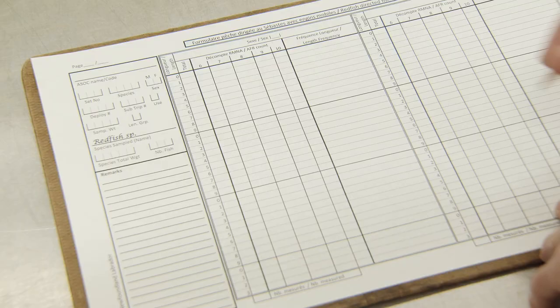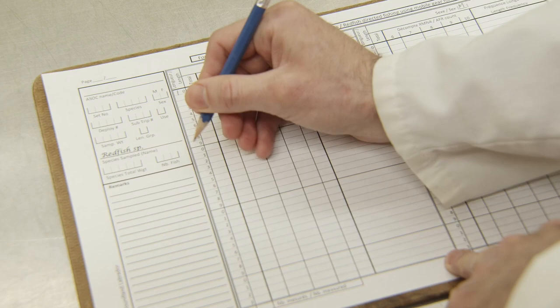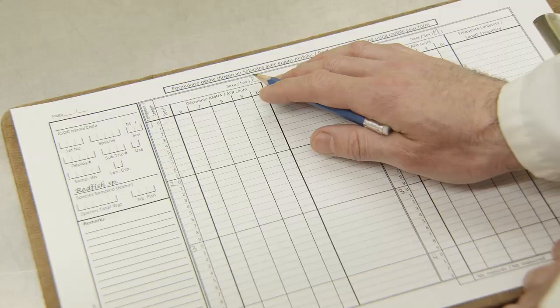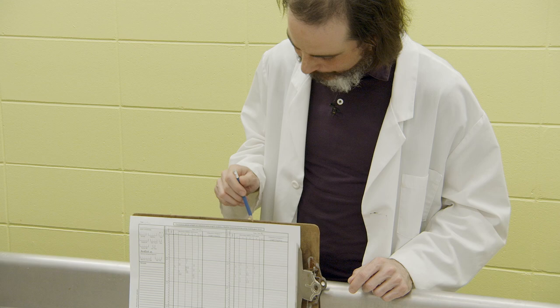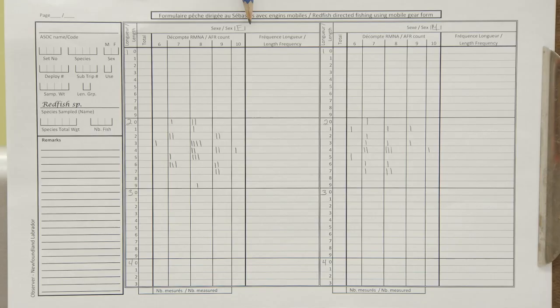The female will be recorded on the left side, the male on the right side. You can start your length at 10. Our first fish was a male, 24 centimeters, seven anal fin ray count — so I will put a check here. Our second fish is a female, 29 centimeters, and it has eight anal fin rays — so I will put a check here. You keep going for the first 50 fish taken at random for the anal fin ray count. The first 50 fish on which the AFR count was done appear in those columns, and the rest of the sample — fork length and sex only — will appear in those two columns.